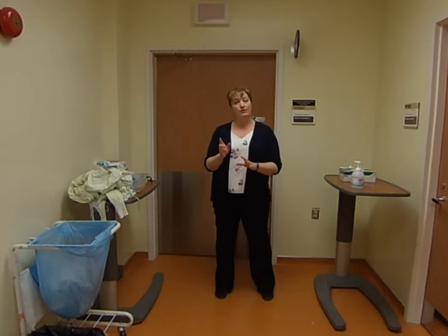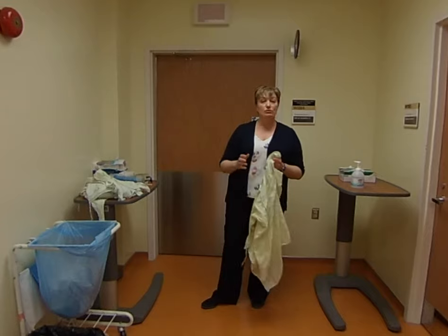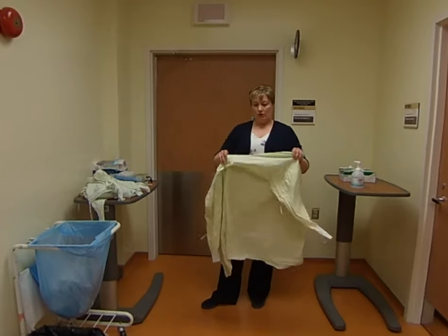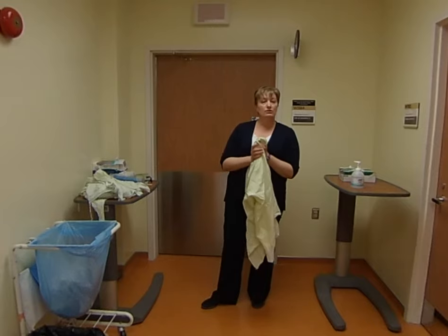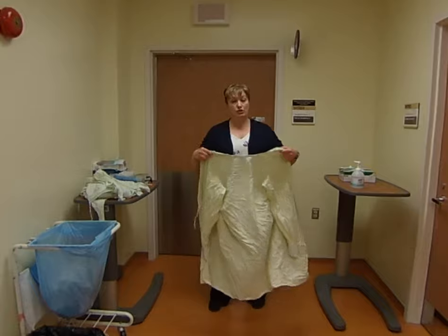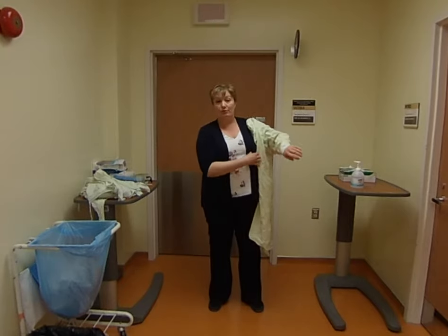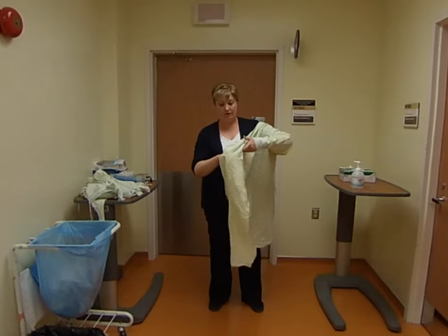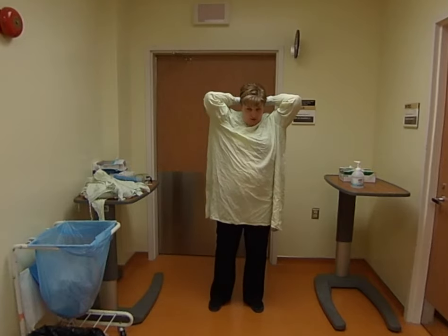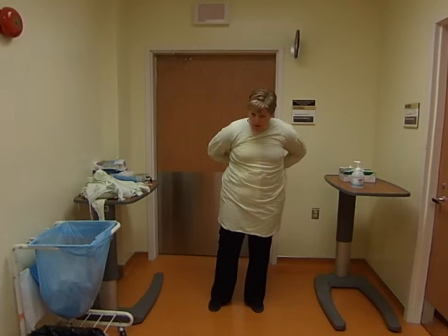So now I'm pretty dry. The next thing you want to put on is the gown. The purpose of the gown is to protect you from anything in the healthcare environment but also to protect the patient from anything you may have on your clothing. Take the yellow gown — it could be yellow, blue, or different colors, and could be cloth or paper depending on what's available. Make sure you put the ties to the back, not the front. Put your arms in and leave the cuff over your wrist to cover your watch — in fact it's better to remove your watch beforehand. Tie it up at the back, then tie it at the waist for extra protection.